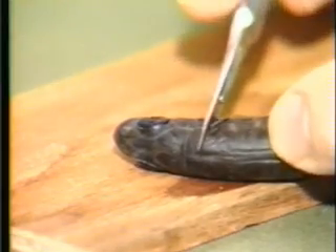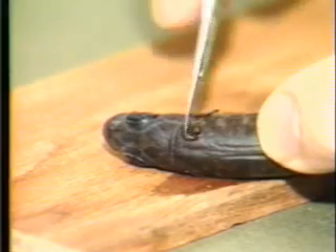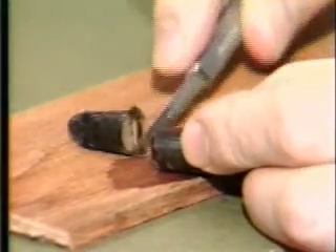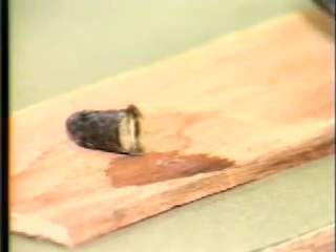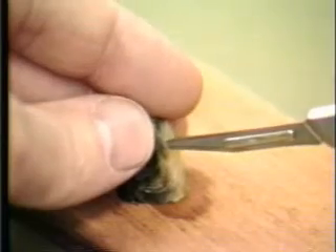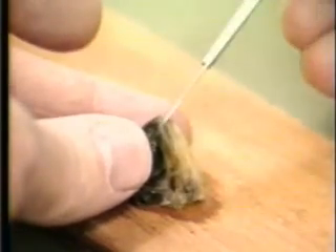In this demonstration, we will make a head mold for 25-per-pound, approximately 120-millimeter lake trout. It will be for a mouth-open tagging, so only the upper jaw is placed in the mold. Separate the head from the body at the nape, or as far back as you want the top of the mold to extend. Remove the lower jaw, being careful not to cut or displace the maxillary bones of the upper jaw.